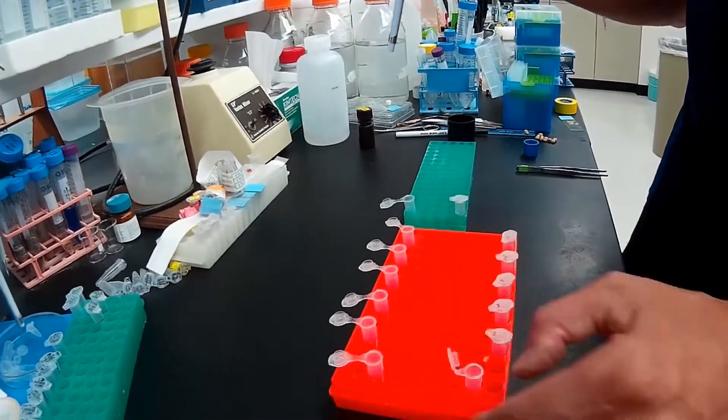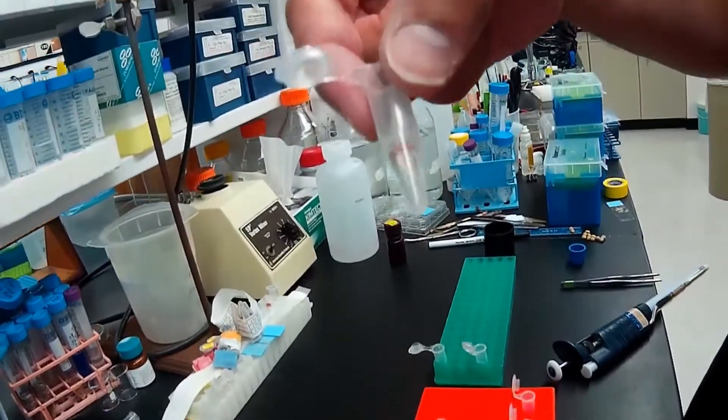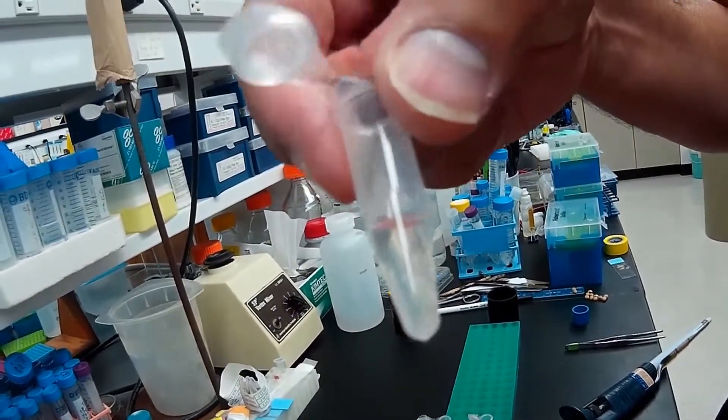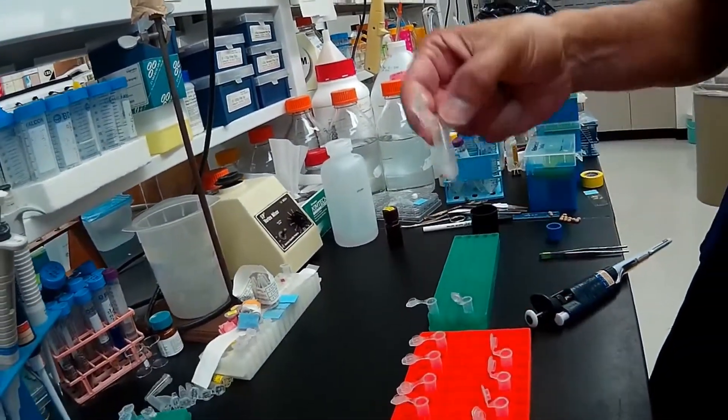Keep your place by moving samples. There we have our cleared solution, and we have the leftover pellet that we're going to discard.